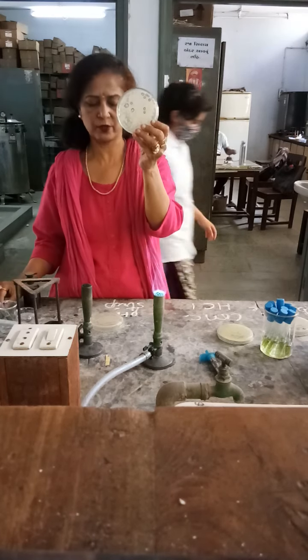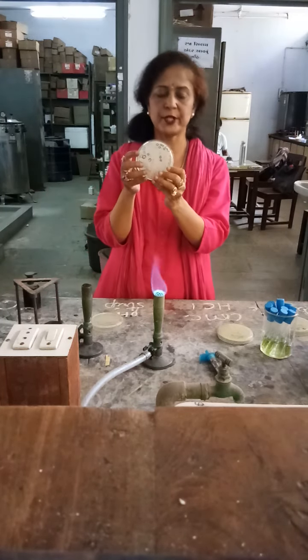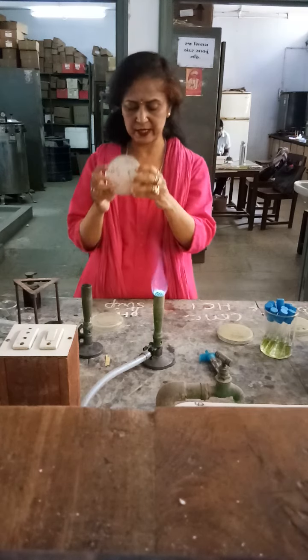So there are many beautiful colonies which have produced antibiotic and have not allowed surrounding organisms to grow, resulting in a clear zone of inhibition. You can see this very nicely in this plate.